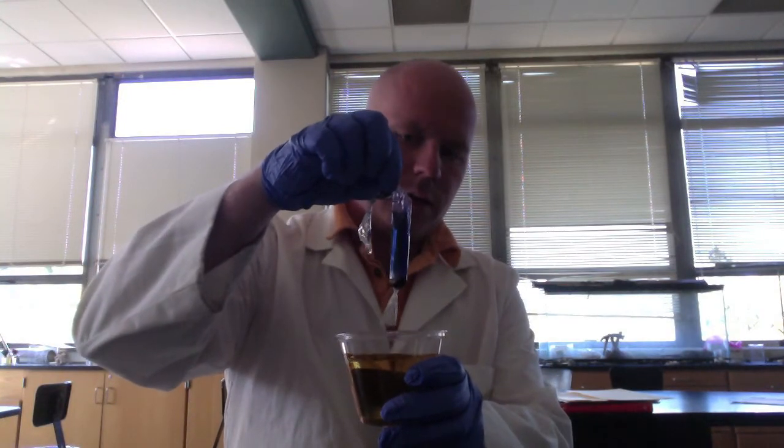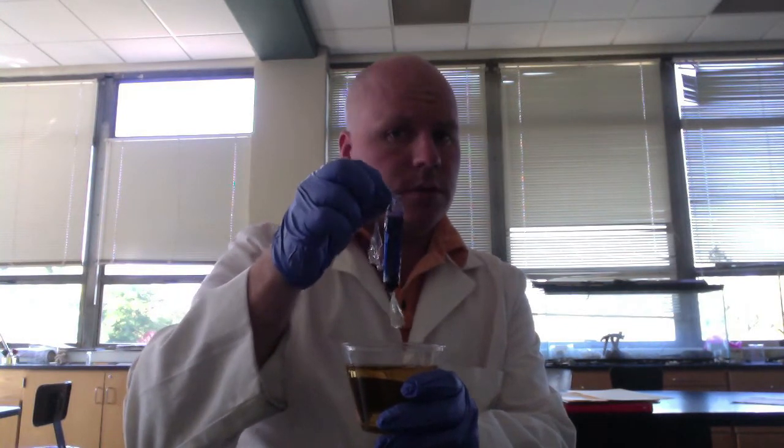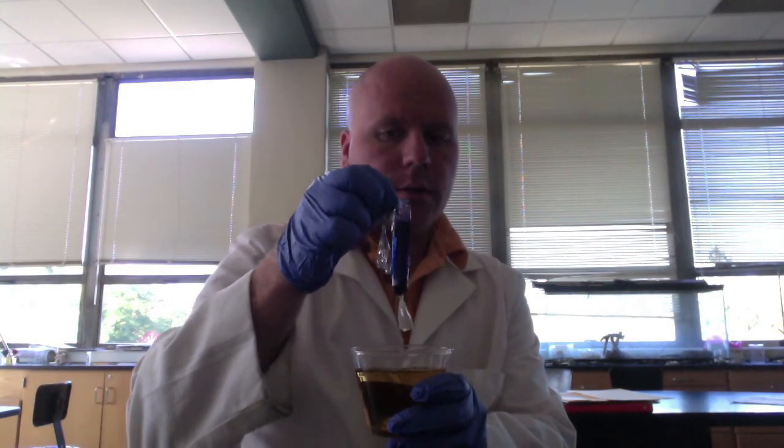All right, so about 20 minutes has gone by, so let's see what has happened with our dialysis tubing. So here is the system. You can see that the water and the iodine is still the same color, but we have a color change inside of the bag. Now if you remember from before, what makes starch turn this color is iodine. So iodine must have gotten in the bag. However, it did not get into the environment, because if it did, the environment would be that color also.